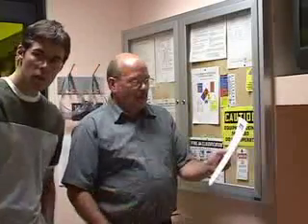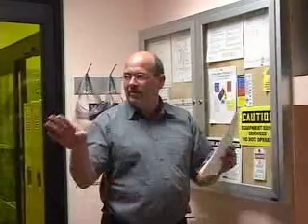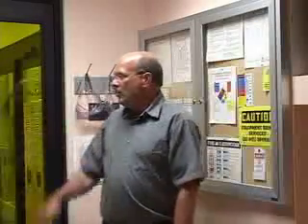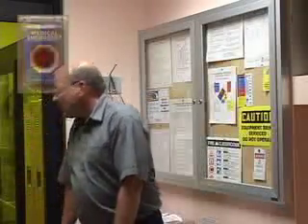Let's talk a little bit more about the alarm evacuation because I've described the pull stations to you: the gas pull station and the fire pull station. The blue one for health is located in the clean room. An example is the one that you see right on the other side of the door. They're also located at the end of each bay typically and throughout the clean room. All right? So that is a way to activate the alarm.